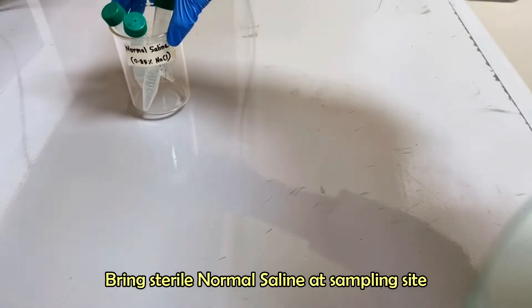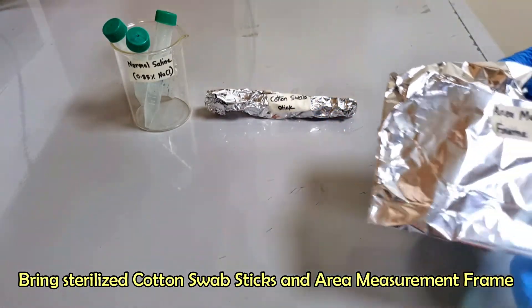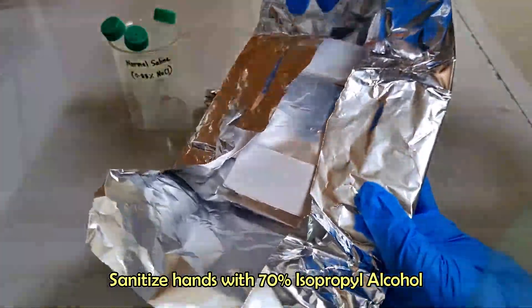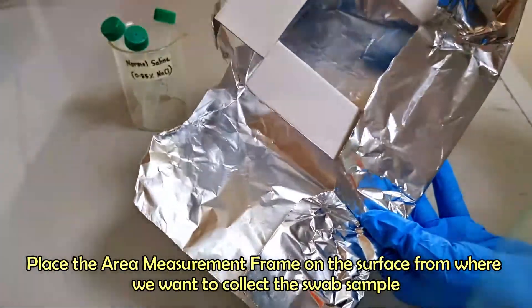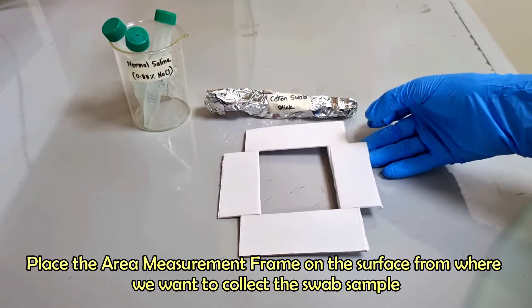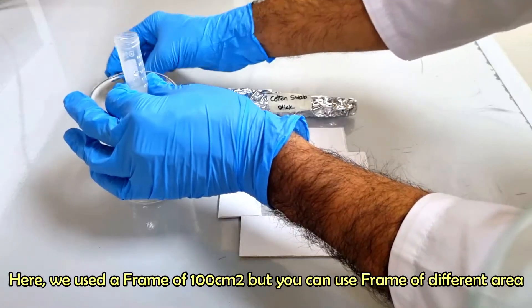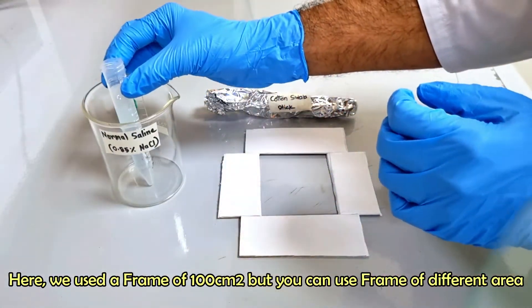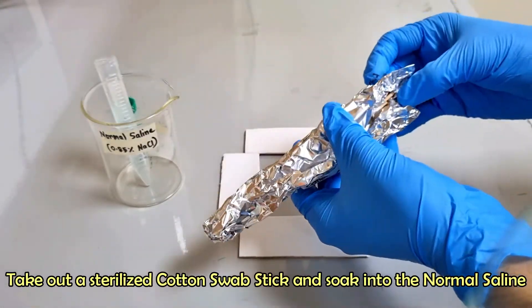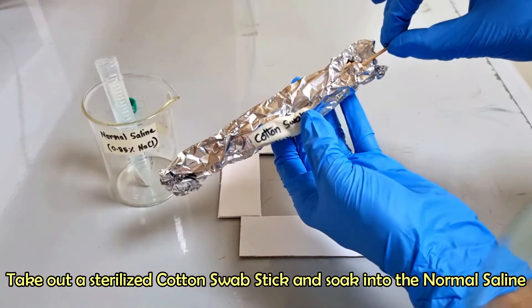Wear gloves and other protective equipment. Sanitize hands with 70 percent isopropyl alcohol. Place the area measurement frame on the surface from where you want to collect the swab sample. Take out a sterilized cotton swab stick and soak it into the normal saline.